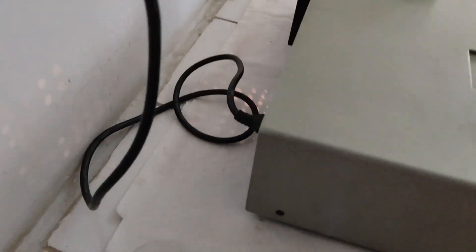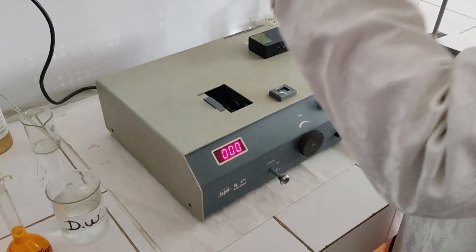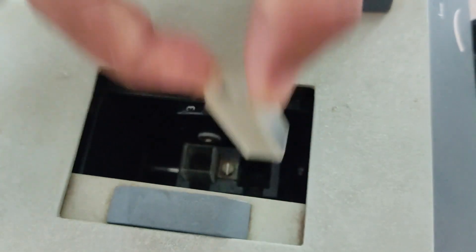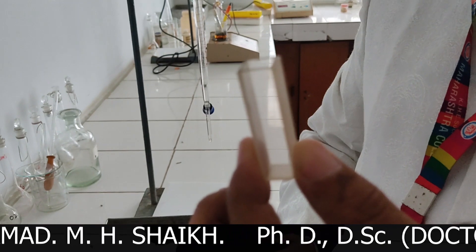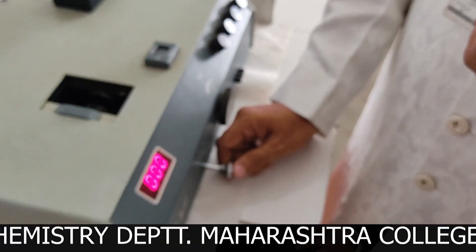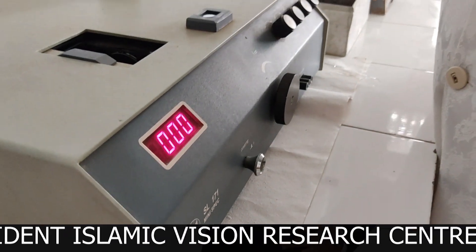First, put the power on. At the back there is an on/off switch — we have put it on. Now I will slide open the sample compartment. You will see there are two sample ports. This is the quartz cuvette — remember it is very costly, its cost is 15,000 rupees, so students be very careful while handling it. This knob is the cuvette position control.